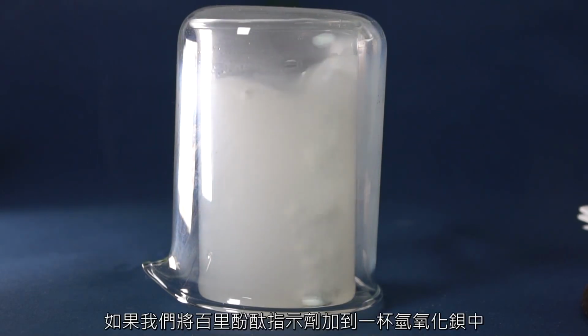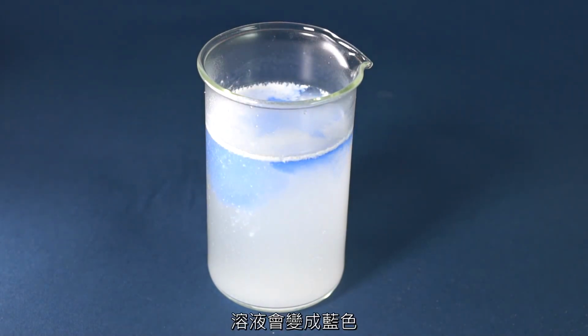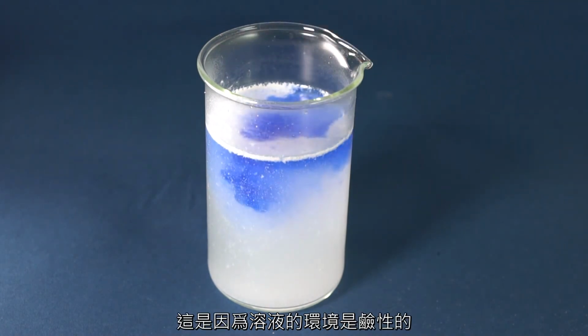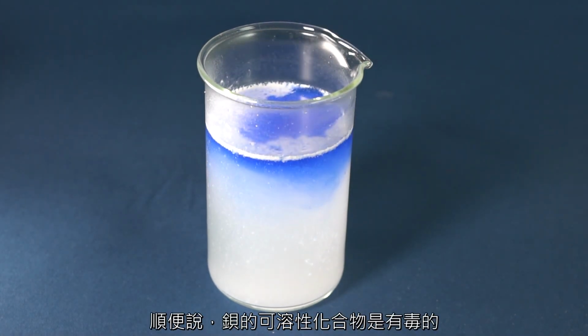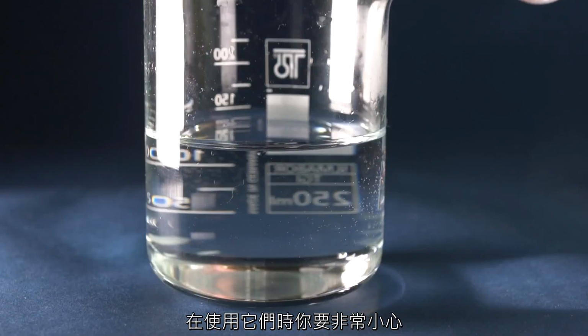If we add the thymolphthalein indicator into the glass with barium hydroxide, the solution will become blue due to the alkaline environment within the solution. By the way, soluble compounds of barium are toxic, and you need to be extremely careful while working with them.